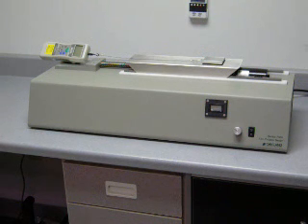The model FX7000 is an analog tester with a fixed speed drive system operating at 150 millimeter or 6 inches per minute platform speed. The model FX7100 is a digital tester also with a fixed speed drive system. The FX7000VS and the FX7100VS, shown here, add a variable speed drive to allow testing at speeds between 1 and 20 inches per minute.